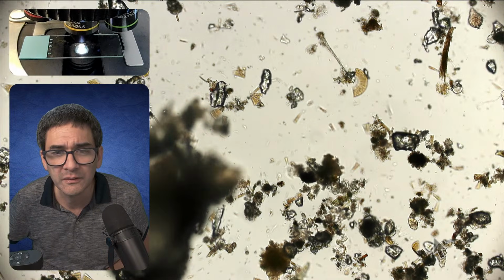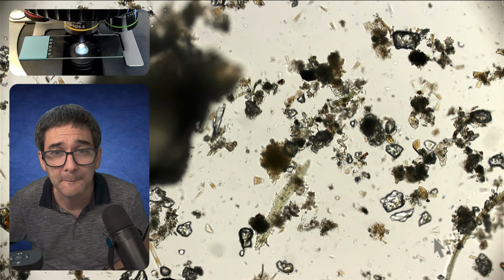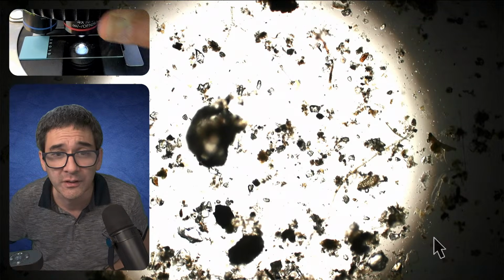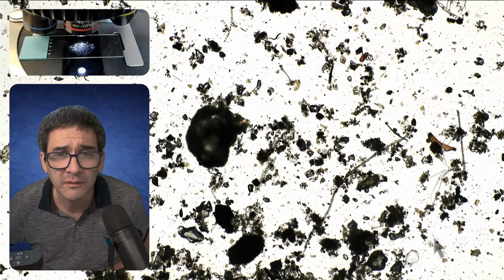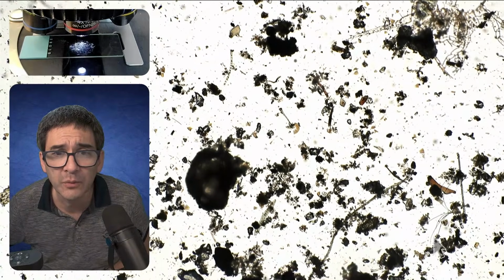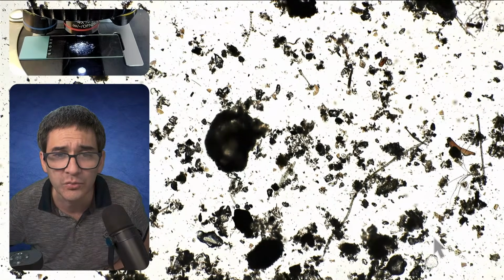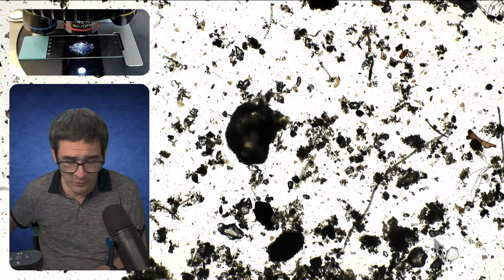from... this is going to be super challenging. This is going to be extremely challenging. I don't know. You know what I'm going to try to do? I'm going to try to risk it even if I might lose it, okay?